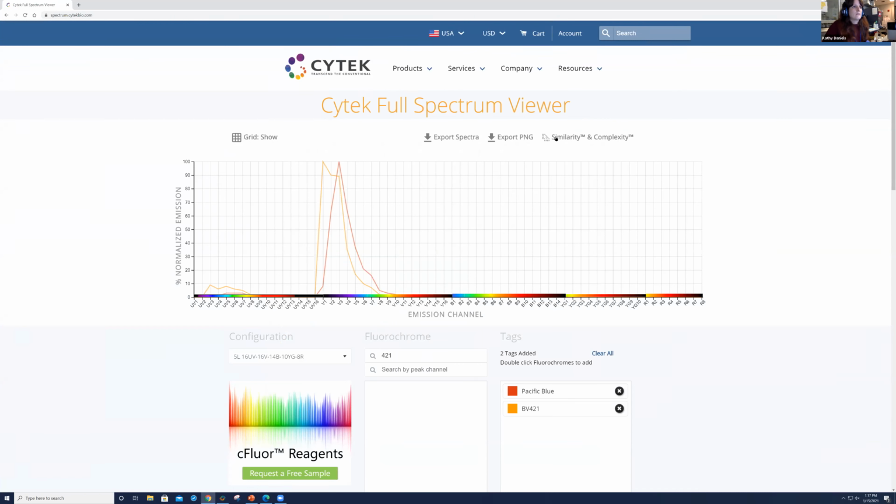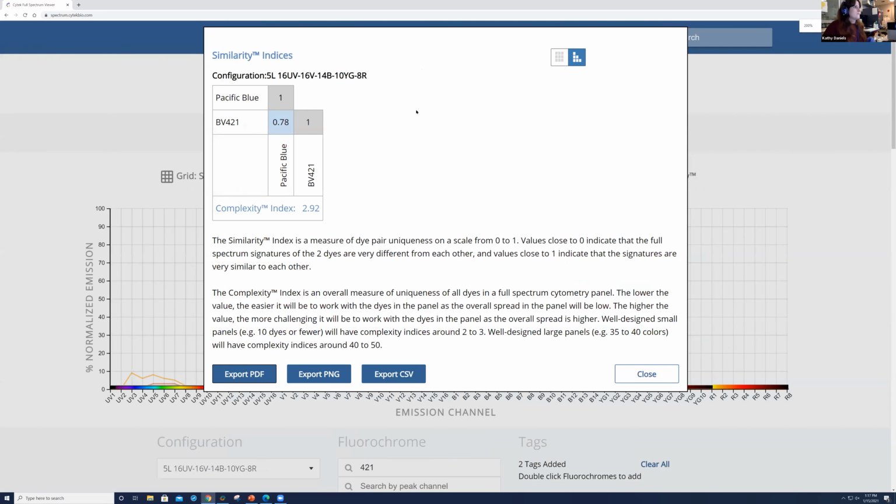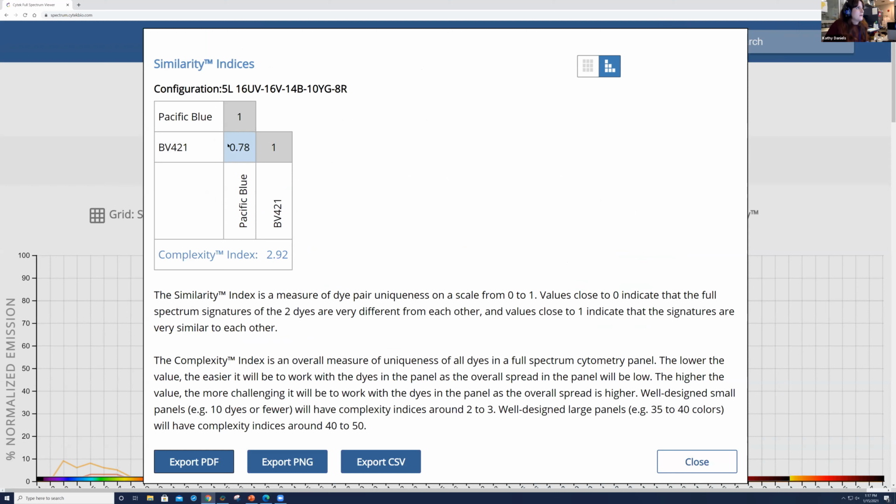In order to do that, you can see where my mouse is hovering. If I click on similarity and complexity, this is a graph that's essentially what Rui was showing us in the slides. It's telling us that the similarity index between BV421 and PAC Blue is 0.78, okay? The closer those values are to 1, the closer they are to being exactly similar, or identical. So we're gonna go back to the instrument now and try a run with mutually exclusive markers, CD4 and CD8 for BV421 and PAC Blue.